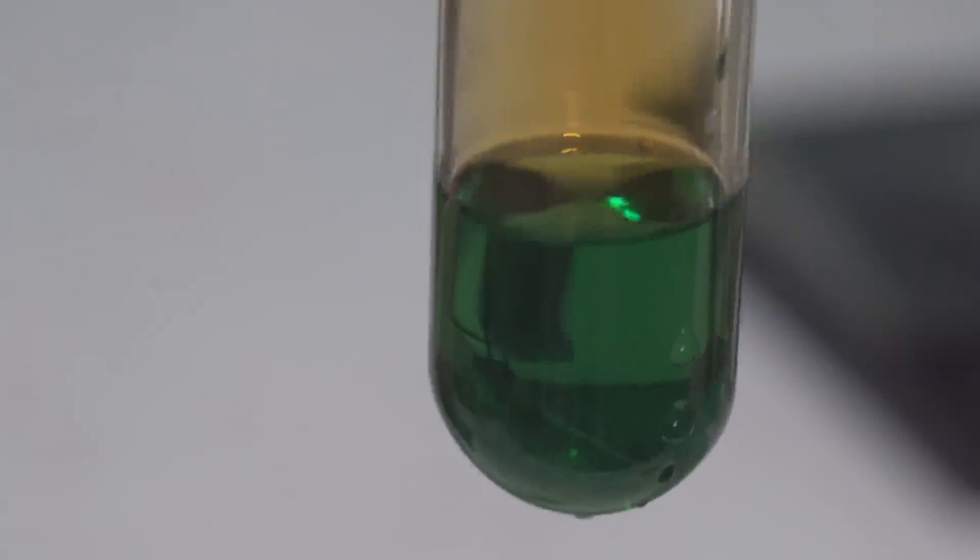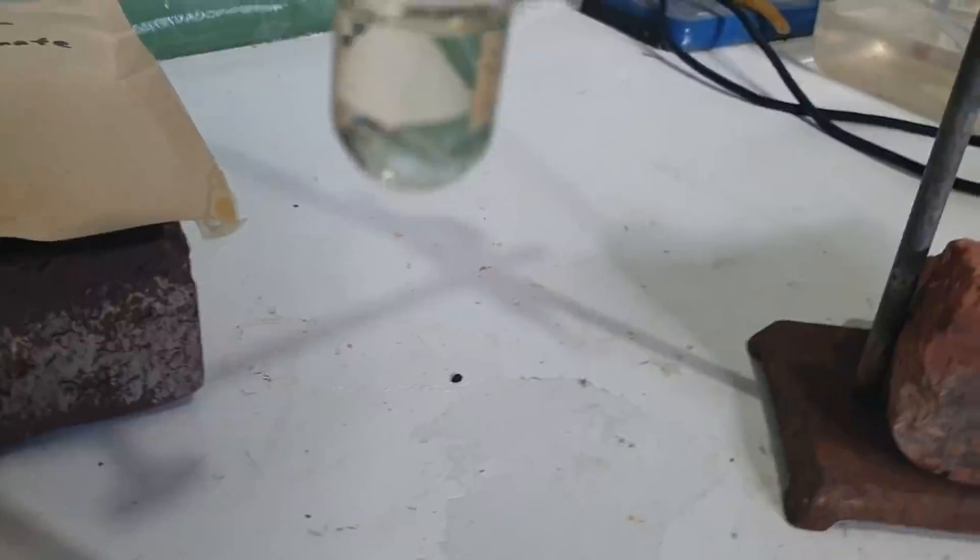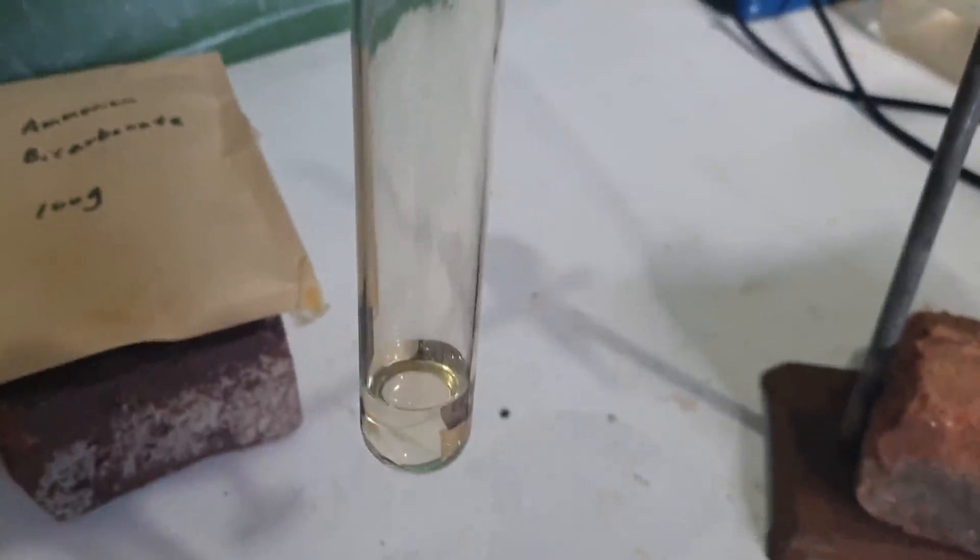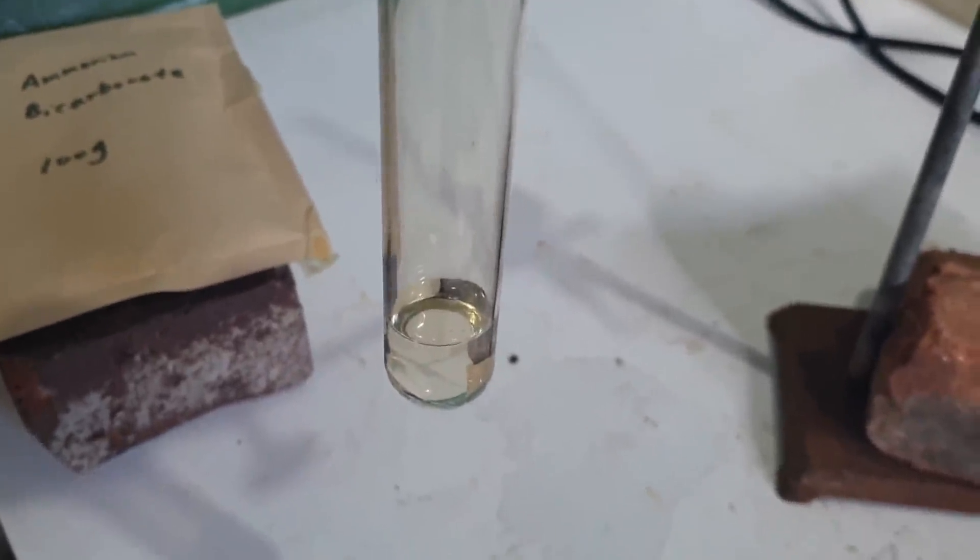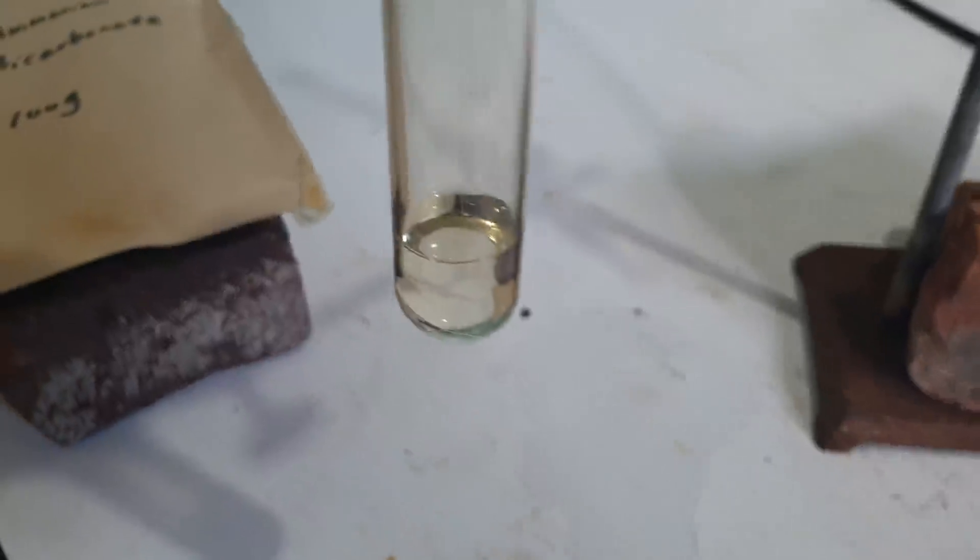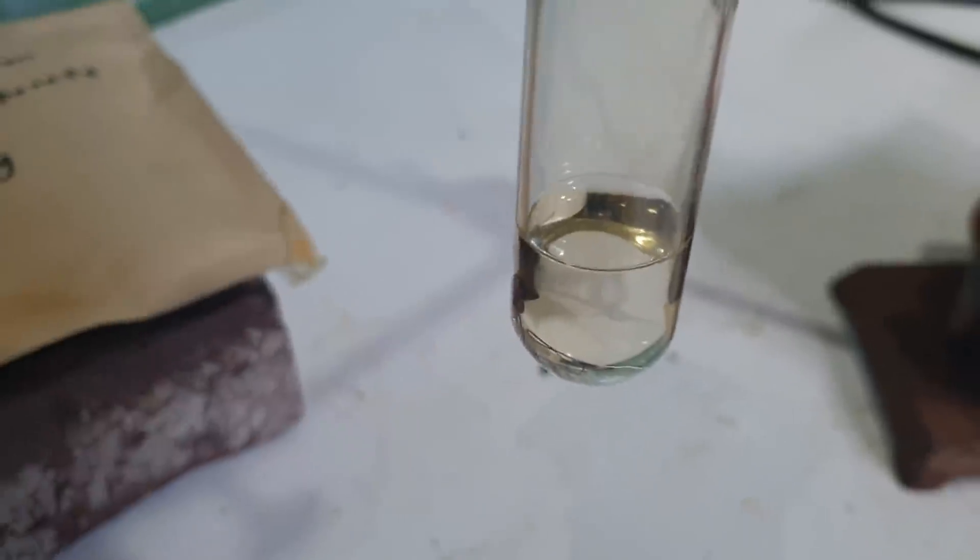All right, letting it stand for a day or two. We see it reverts back to sort of off-yellow colour rather than beautiful green. I suppose the beautiful green was just the nitric oxides dissolved into the nitric acid. Makes that sort of green colour. It's really nice, but it wasn't real, and it's a nice reminder that all good things are fleeting and we are born here to suffer.